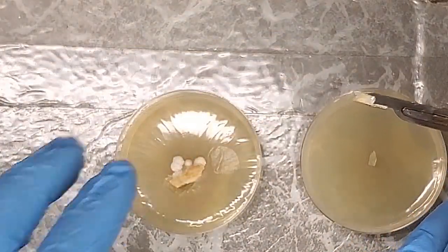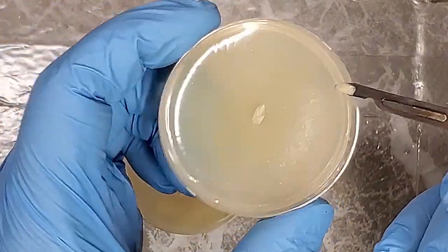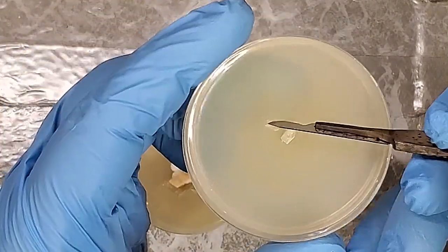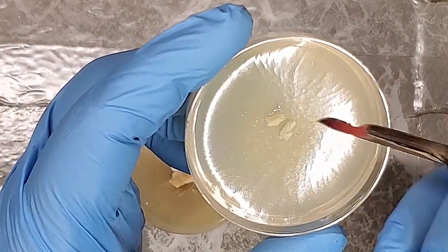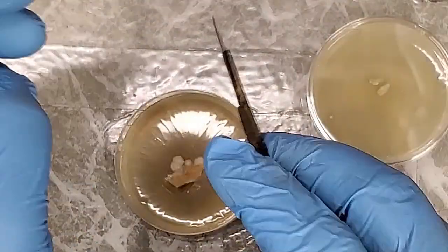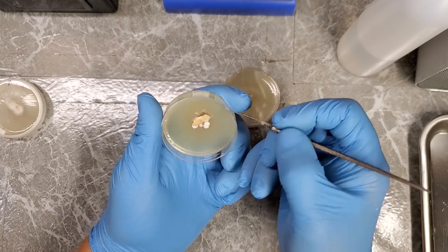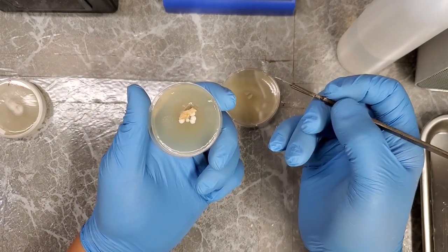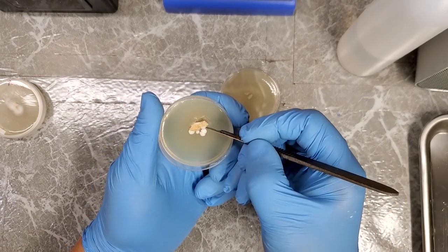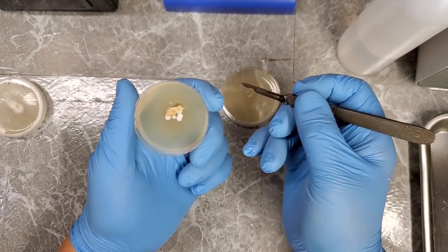And obviously you want to be doing this as quickly as you can, but since I'm using this for a demonstration, I'm just kind of walking you through the steps. But we want to take a very, very small sample of clean culture and then put that onto another sterile petri dish, right? And then close it up and put it in the incubator or whatever you want to do. But by taking a very, very tiny sample, we're just trying to use geometry to our advantage here. The less surface area that you're working with if you're taking a mushroom sample, the less chance of contamination you have, just because there's simply less of the culture there to worry about having microbes on it, right?